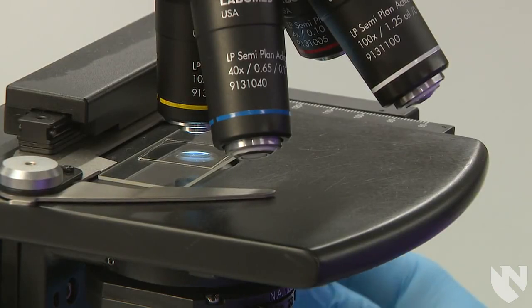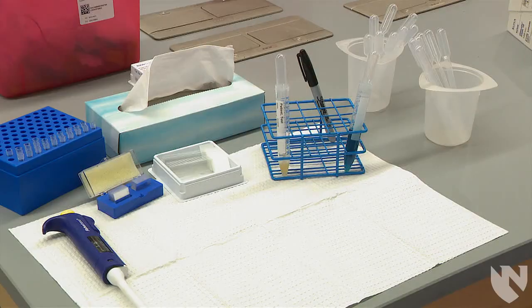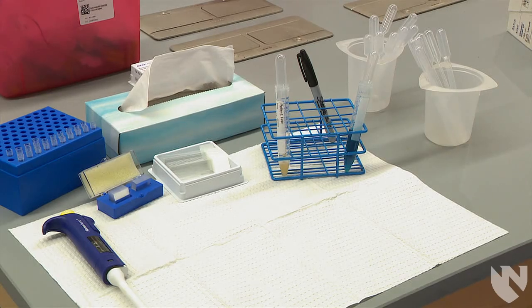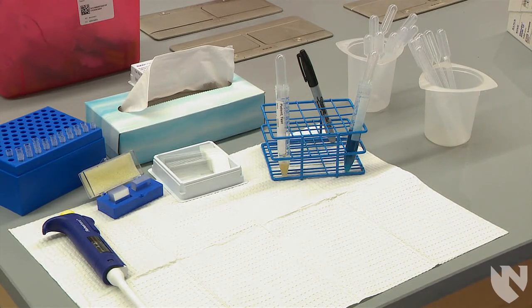A glass slide with a cover slip is another way to prepare a sample for a microscopic exam. To standardize the volume of urine, we make sure to dispense the same amount of sample onto each slide for every urine we examine.